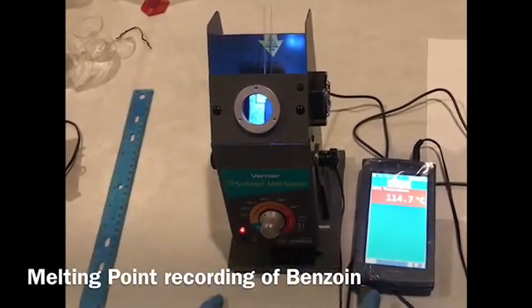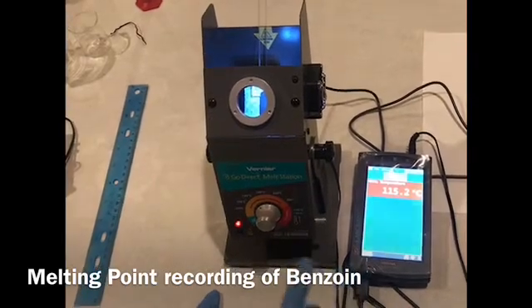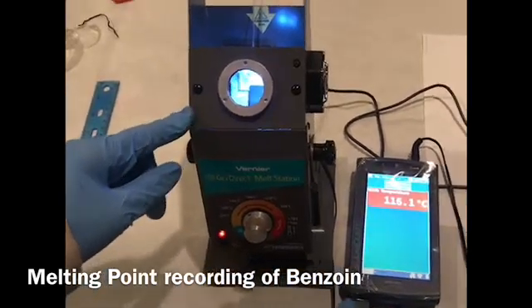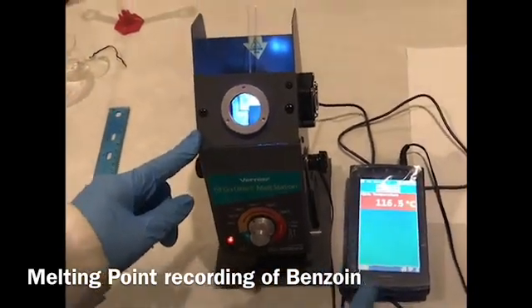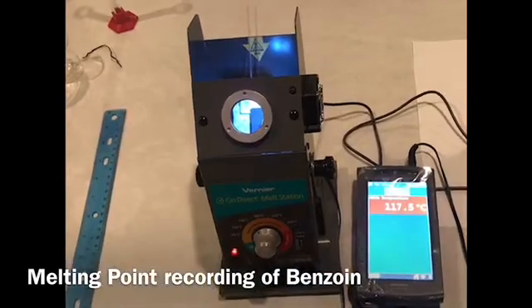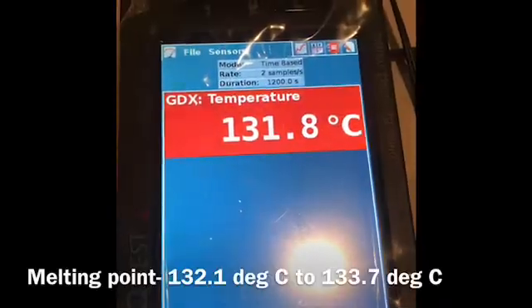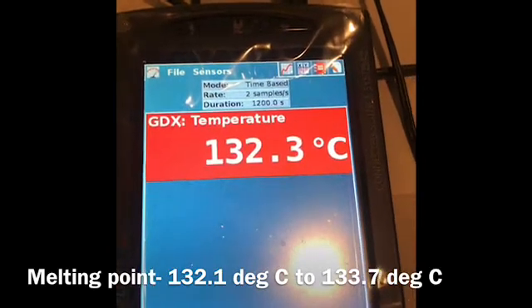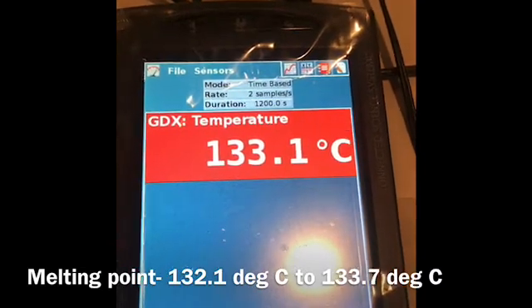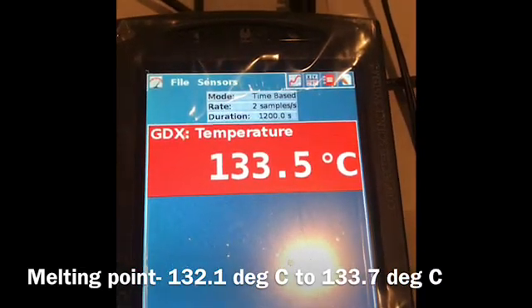Now I am taking the melting point of benzoin. This is the setup — the Vernier LabQuest 2 is used as the interface to record the temperature. The capillary tubes are already in. My compound has started melting now; I will record the range. It looks like a fairly pure compound as far as the melting point is concerned.